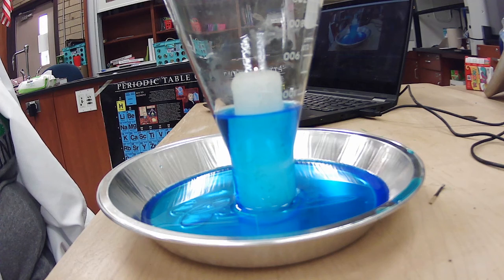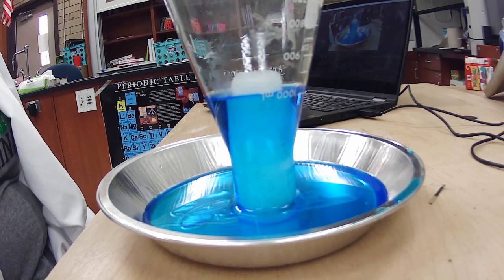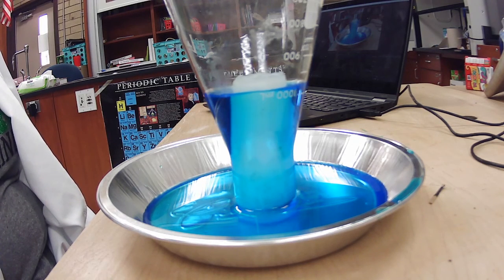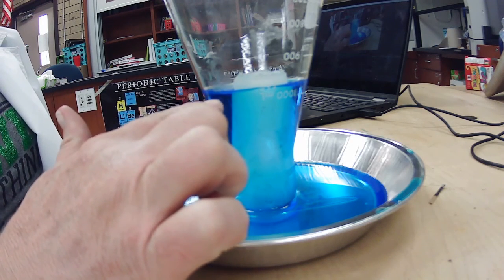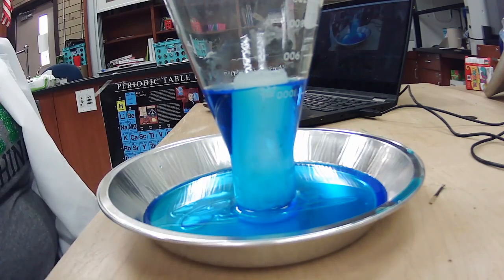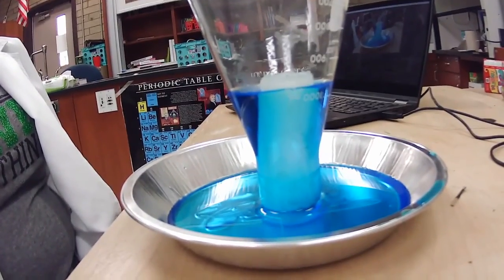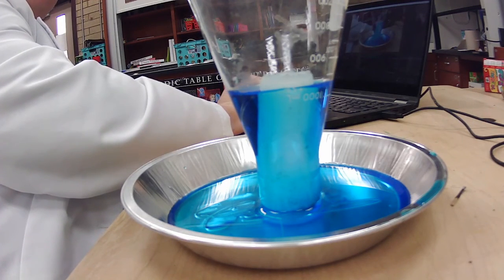Some of you may say a vacuum. You are correct. But what's happening either to the pressure or the temperature of the air? Okay, and now it's actually put out our candle, but you can see we've sucked up a lot of this liquid, displacing this air. So what's happening to the air? Okay, and which gas law did that just demonstrate?